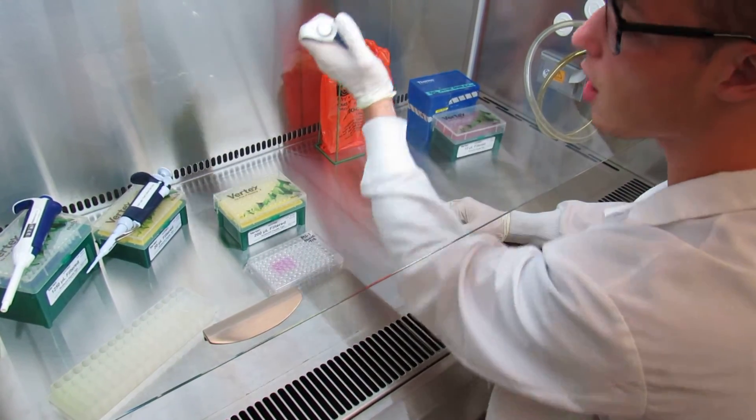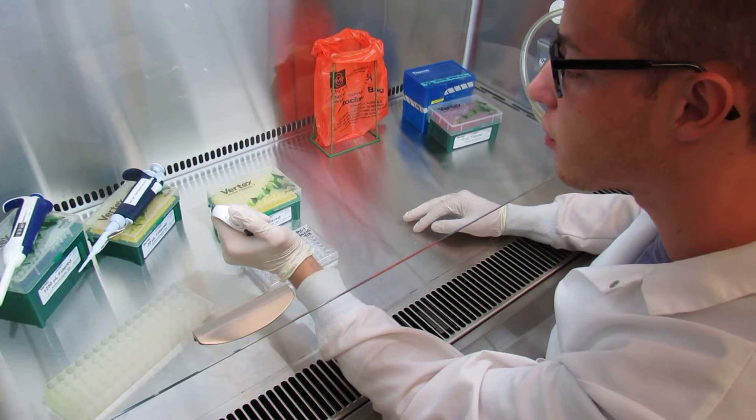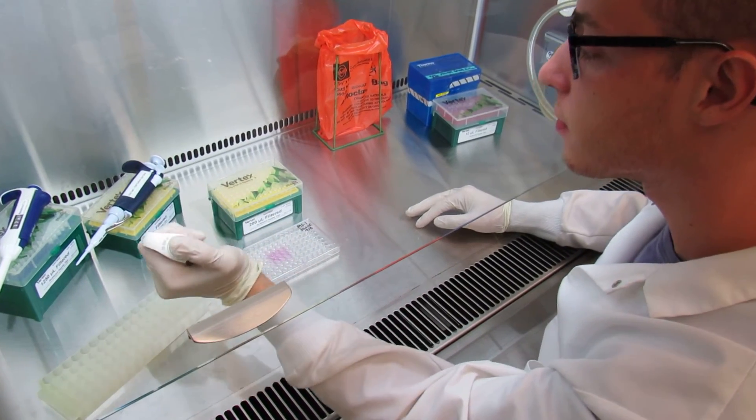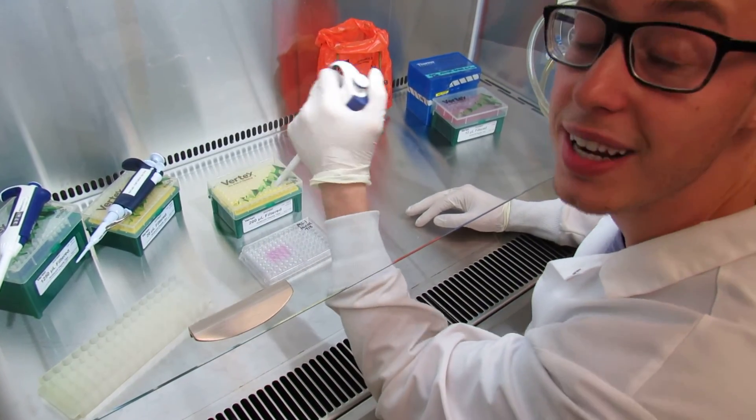So be mindful of which well you've added dye to as well as be mindful of how much you're adding. And that's pretty much it.